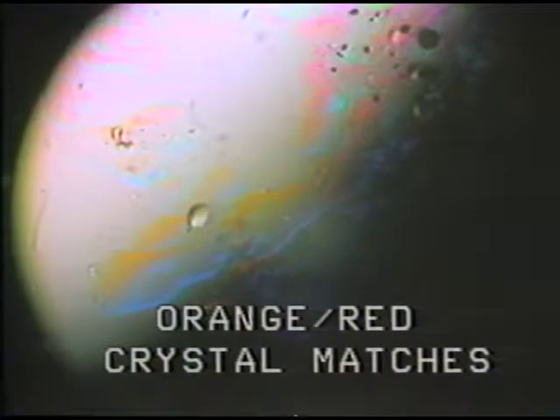When we're very close to a match, the oblique test is the best test to perform, and we're really looking at the color of these color fringes. So here now, looking at the mineral grains, you can see that the color fringes have a very distinct orange-red or red-orange kind of color. And this color is very distinctive of a precise match of the refractive index of the liquid with the refractive index of the crystal.